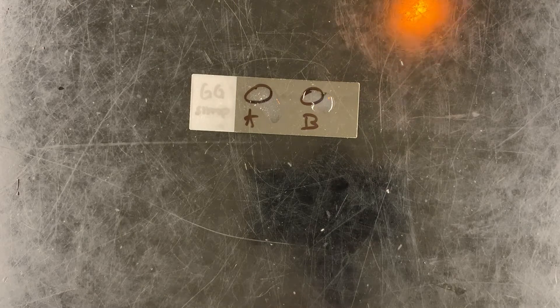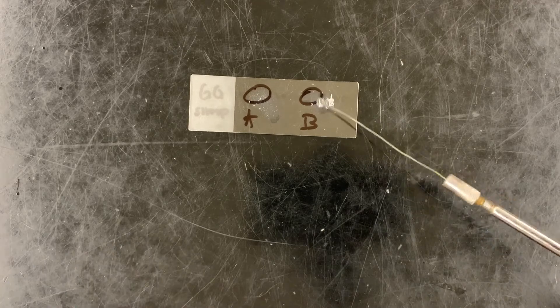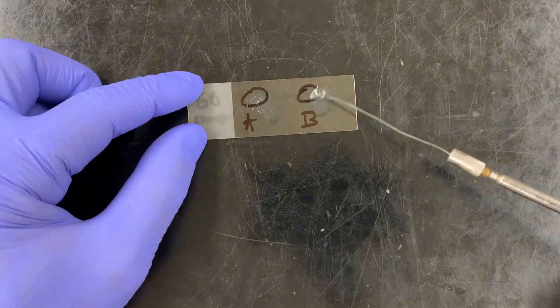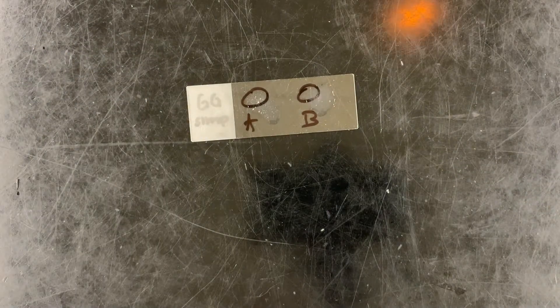The reaction proceeds usually pretty quickly — I'll zoom in on that in a second after I add bacterium B. Sometimes it can take upwards of about 30 seconds to even a minute, depending on how healthy the bacterium is and how much bacteria was put down. Now I'm going to put test bacterium B into our rabbit plasma drop, give that a mix, make sure it's well mixed.